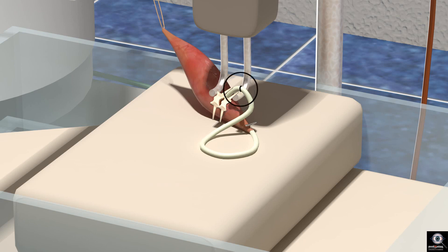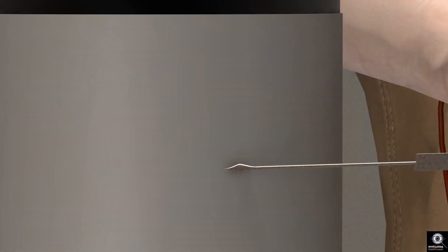We mark the point on the nerve at which the electrode is applied. We record the muscle twitch on the graph paper.